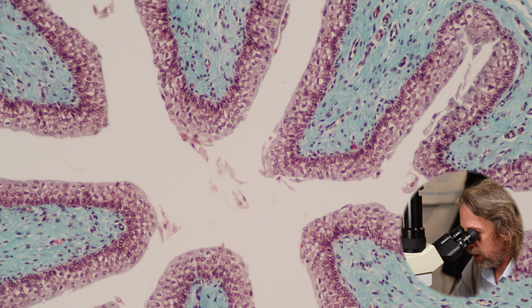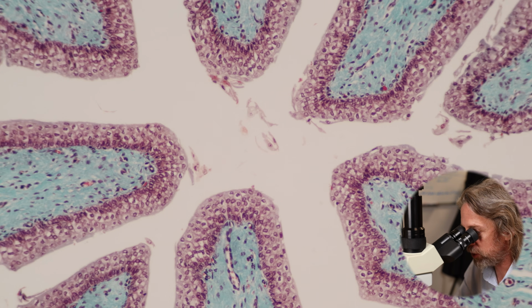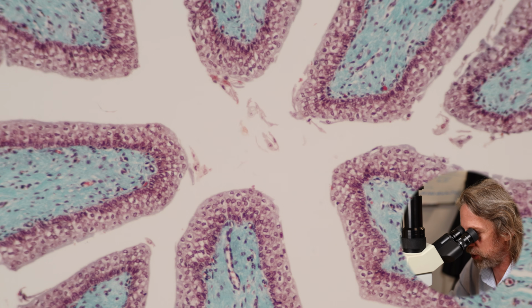The inner layer is longitudinal and the outer layer is circular. This is because, let's jump up to a higher power, this is because the ureter is a muscular tube. It can propel urine along this lumen. It doesn't need gravity. It's not a gravity-fed system. When you're lying down, the ureters can carry urine from your kidneys to your bladder. This is important. When you're in space, it can do the same job.